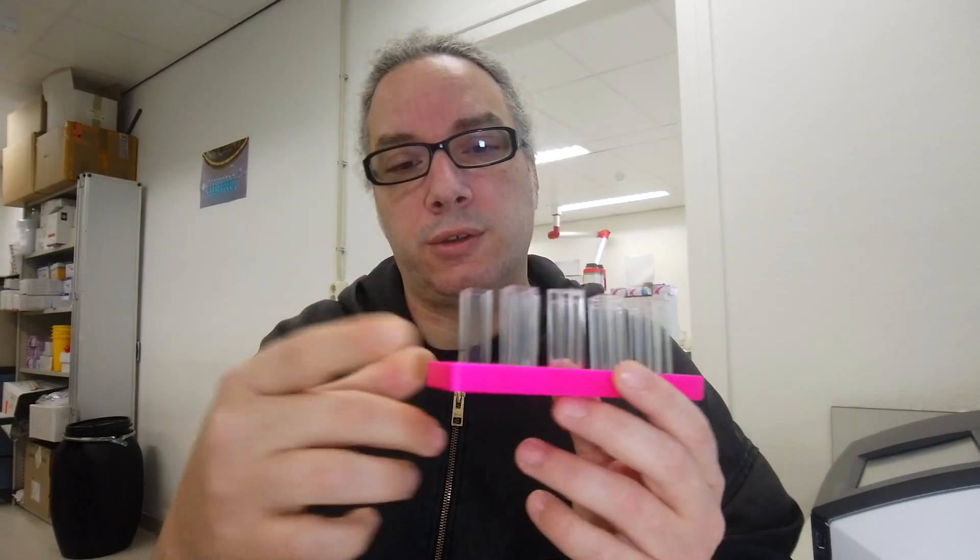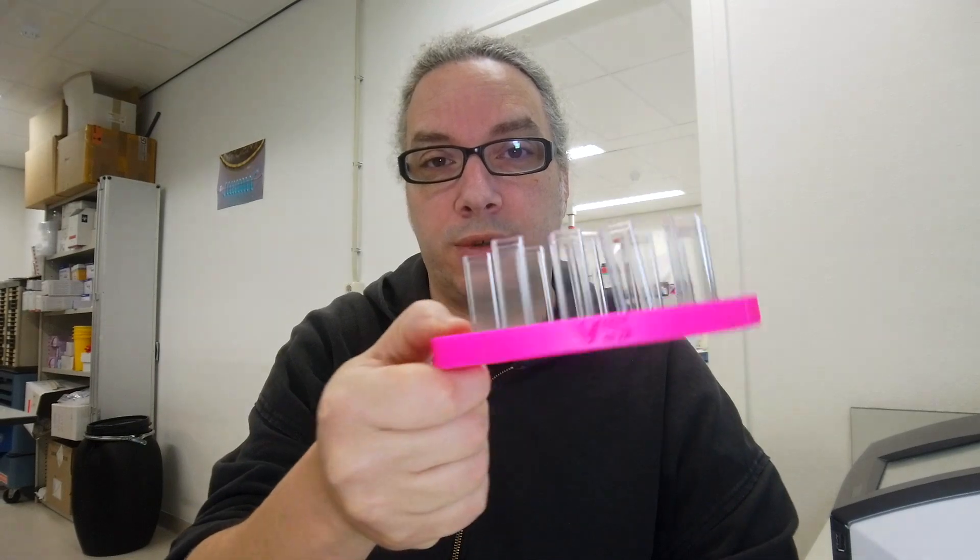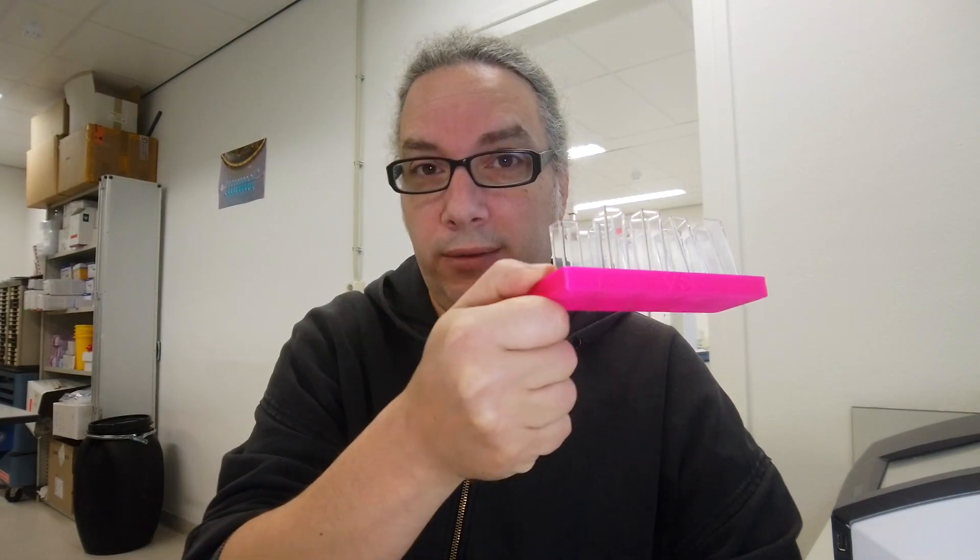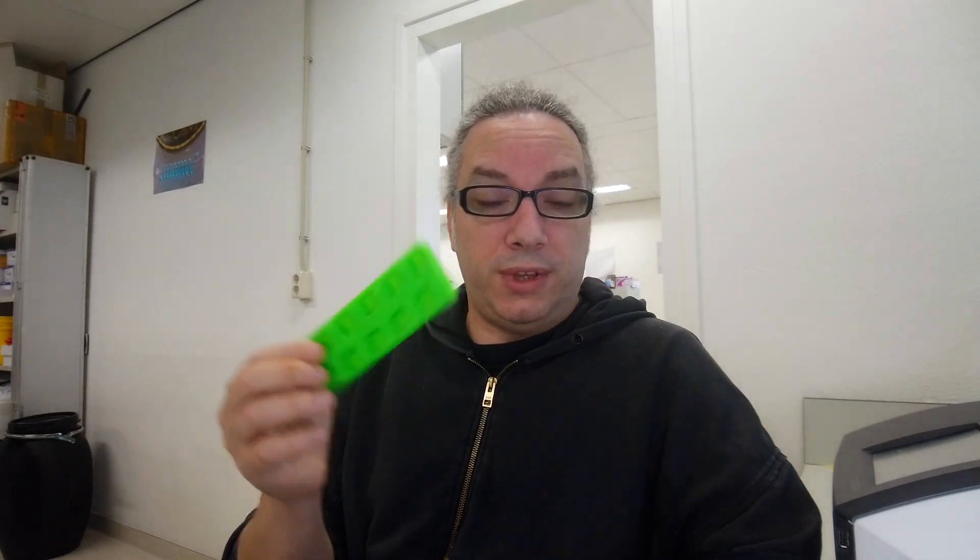And also the other nice thing is that you have one free space for your thumb, so you can move like that. Okay, the design worked. And the beauty of 3D printing your cuvette holder is that you can customize it. So if you want to have 5 cuvettes, you can do it. If you want to have 50, you can do it. If you want them to fit in one of your drawers, now you can do it. And that's pretty impressive because now you can do whatever you want.